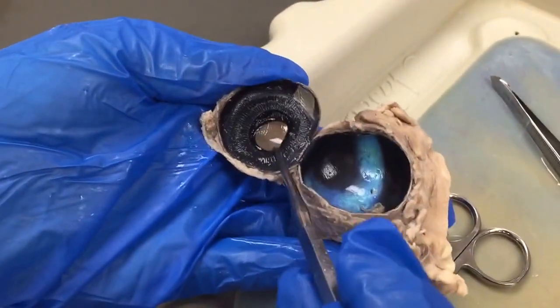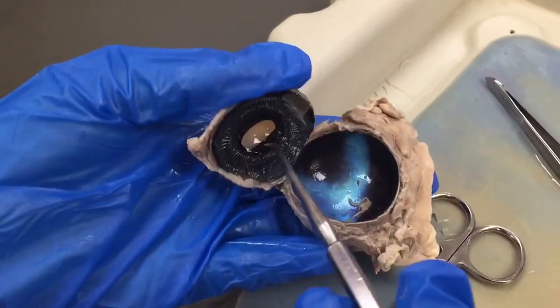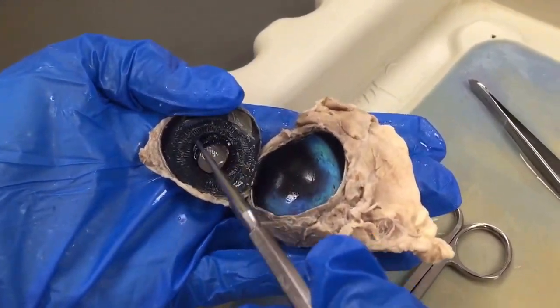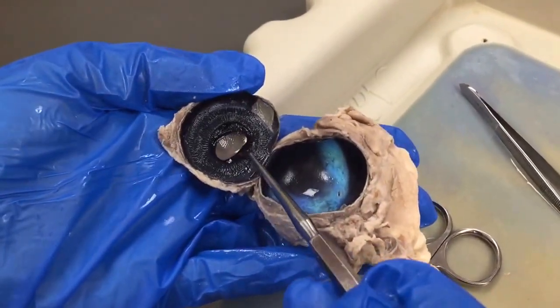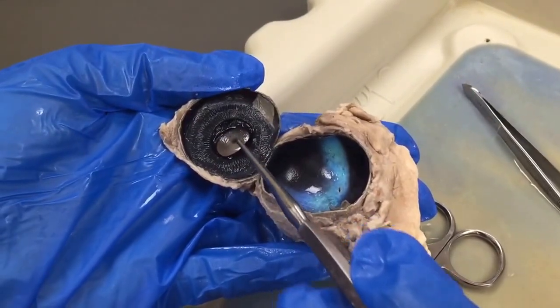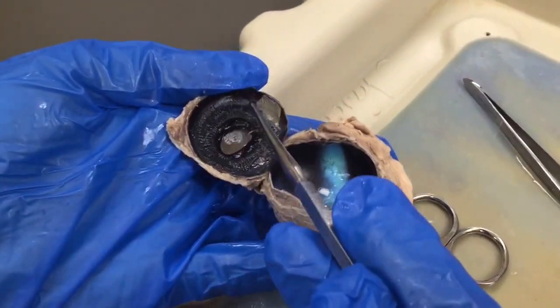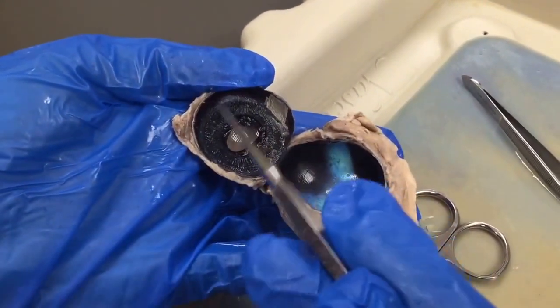You can see the lens here. You can see the iris, obviously, from the other side here. That first big circle is where it can contract — where this can get smaller or larger — and make the pupil opening bigger or smaller to let different amounts of light in. And then these black lines around here are the ciliary bodies.